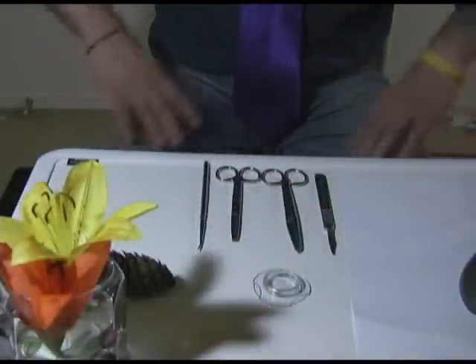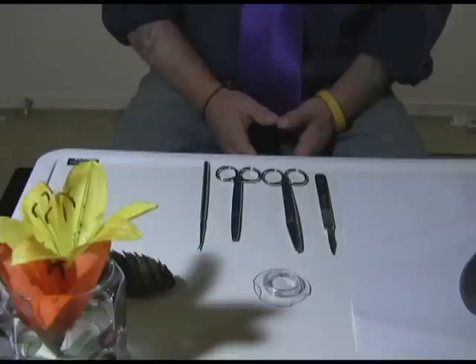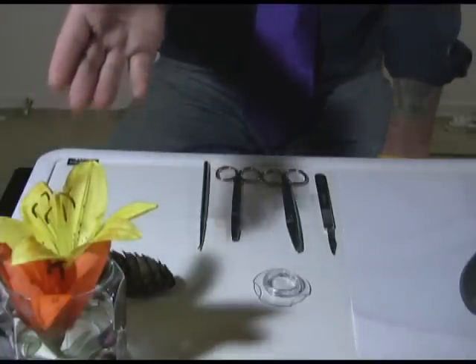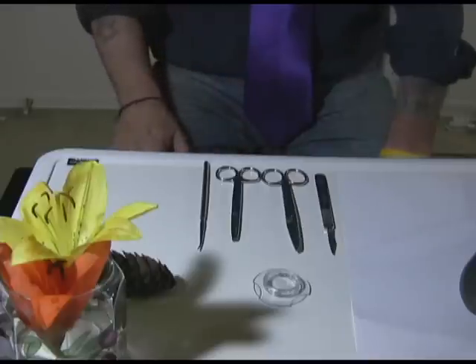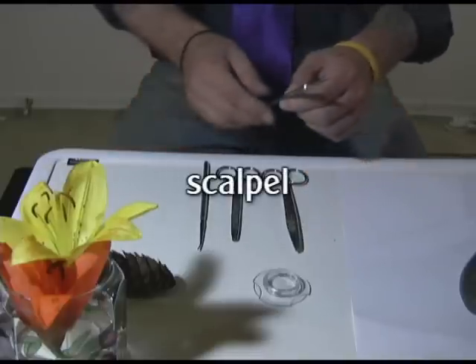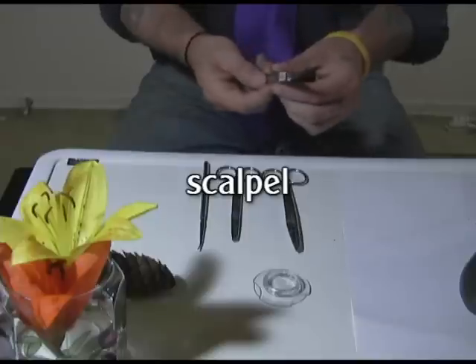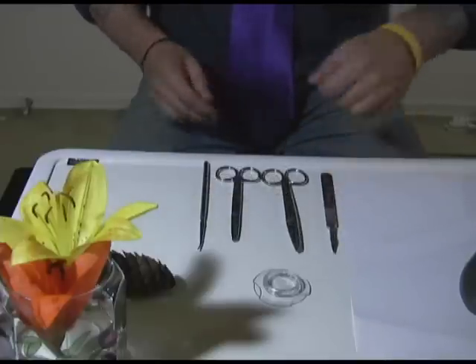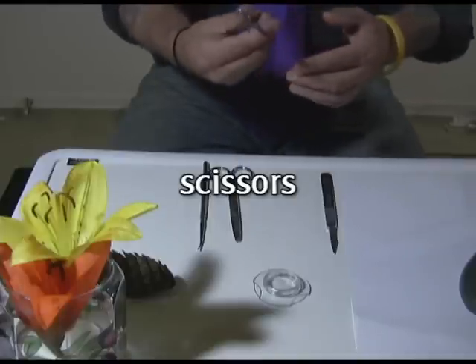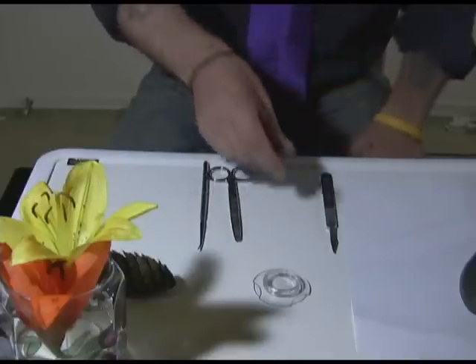All right, so here we are with my workstation all set up. Let's go through some of the equipment I'm going to be using for this flower dissection. I've got my flower specimens right here — nice and large flowers, easy to see. This one is the scalpel, which is used for cutting. You need to be very careful when you use a scalpel. Over here we've got a couple of pairs of dissection scissors, and we'll be using those to cut off parts of the flower — the stamens, the pistil, and all these structures.